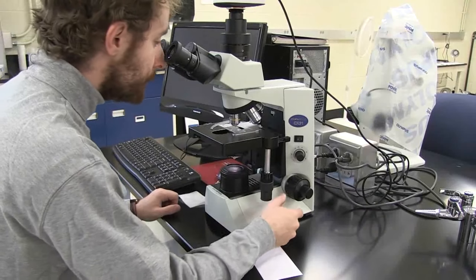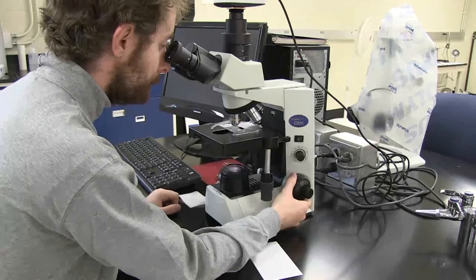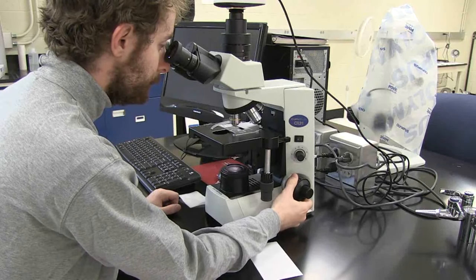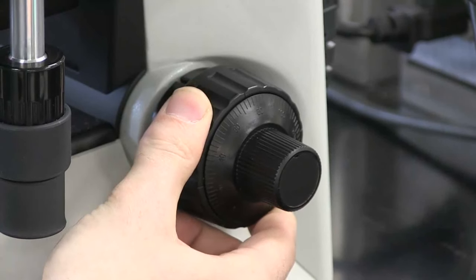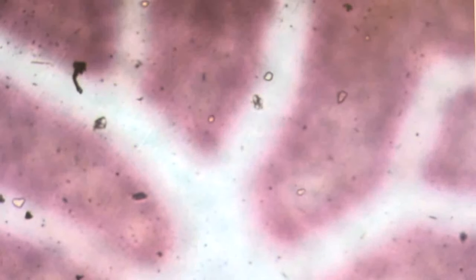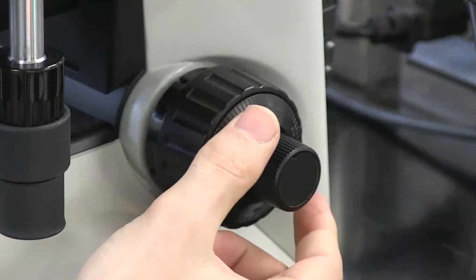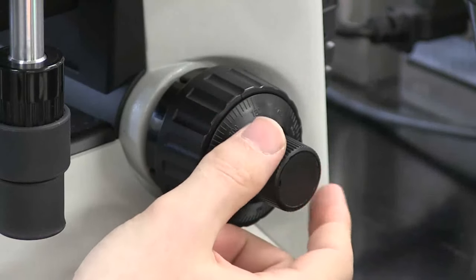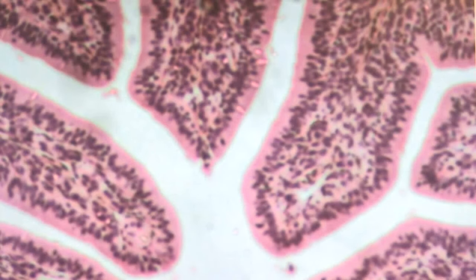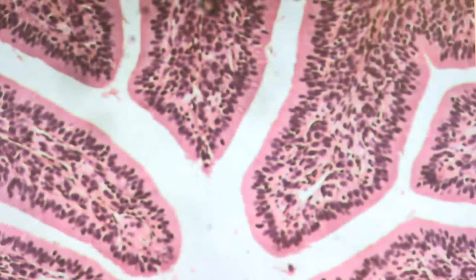While viewing through the microscope, use the coarse focus adjustment and lower the stage until you begin to see an image. Once you have seen an image, use the fine focus adjustment knob until the image becomes clear.